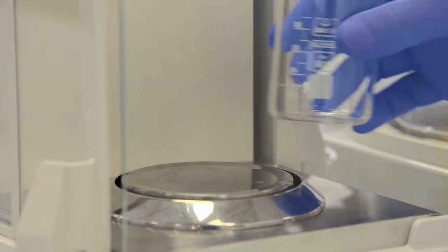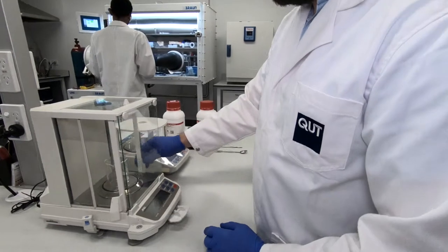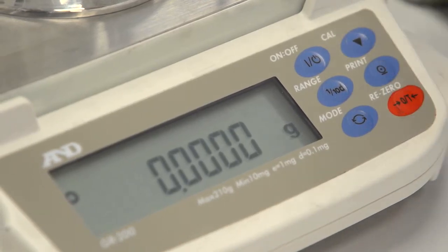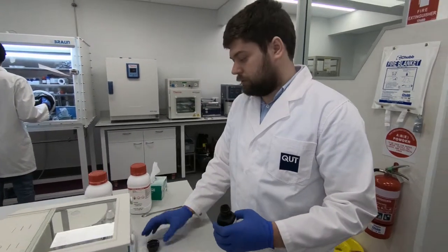For this we need to weigh this glass first, pre-zero its weight, and add our powders to the glass.